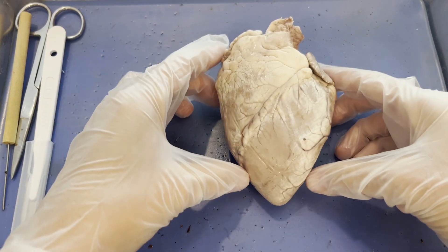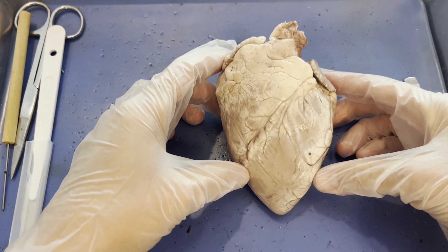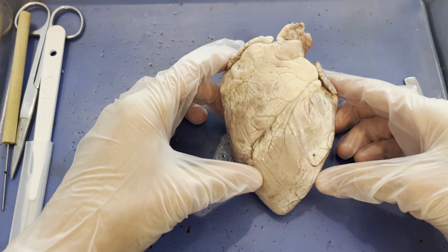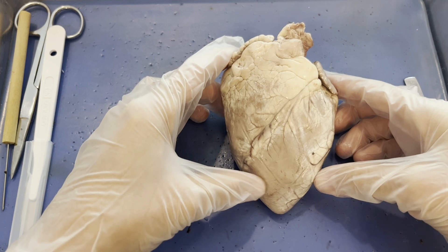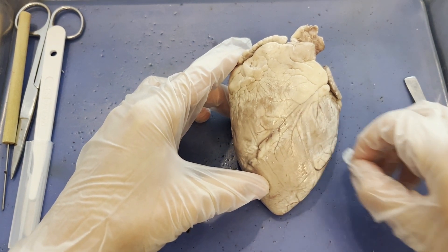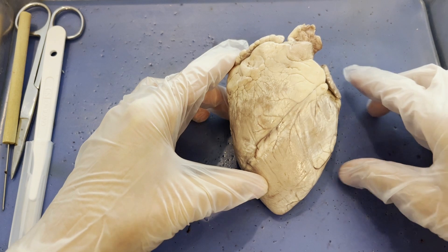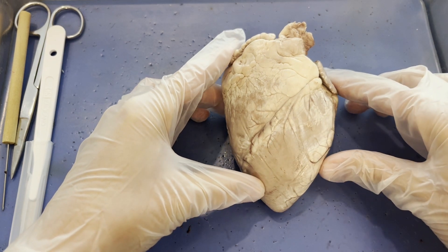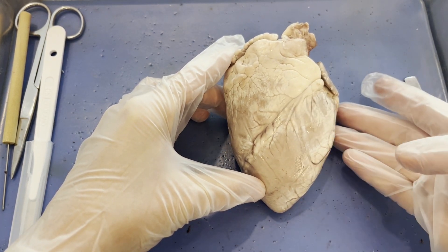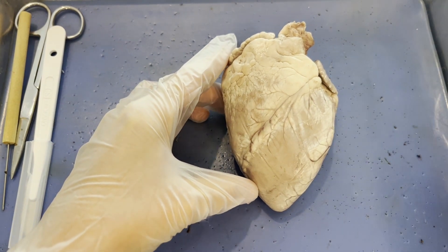You are looking right now at a sheep heart, which is a great model organ for a human heart because like all mammalian hearts, the sheep heart has four chambers. And even though it is significantly smaller than a human's heart, the sheep heart will have the same external and internal anatomy as a human heart does.